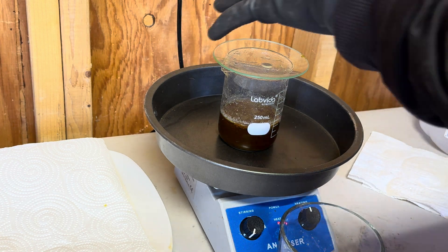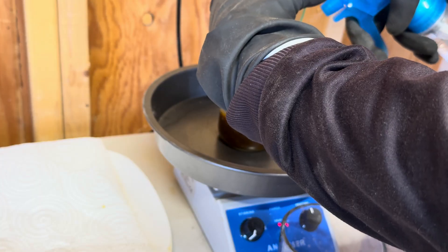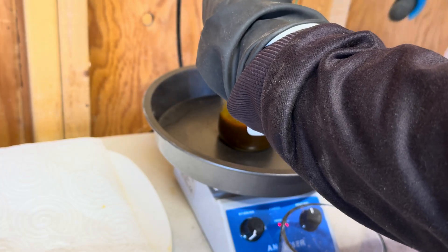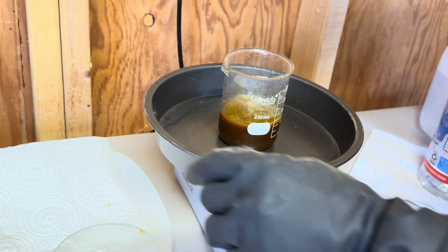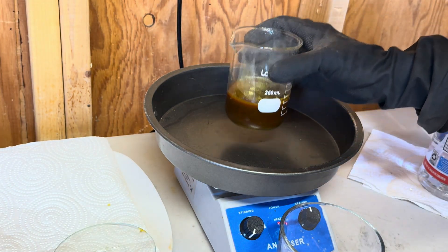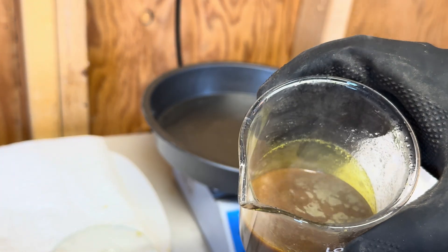As you have probably noticed, I did replace my Pyrex dish for a metal pan because it's pretty cold outside and I've been having a difficult time getting this to a boil. I didn't want the glass to shatter, and I know with a metal pan it's not going to shatter, so let's keep boiling.